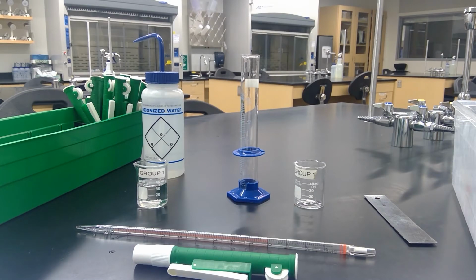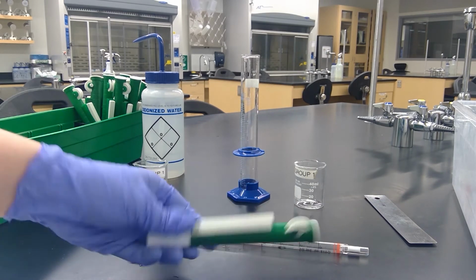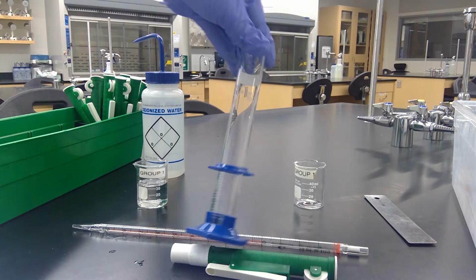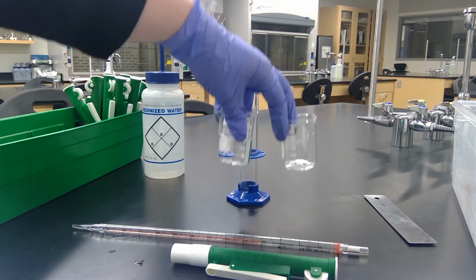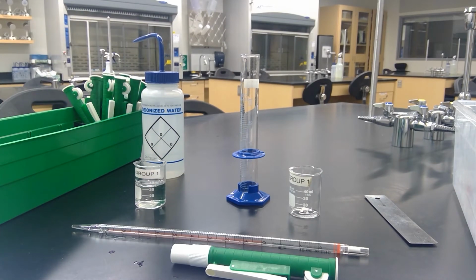For this section, you will use a 10 ml pipette, a pipette pump, a 50 ml graduated cylinder, and 2 50 ml beakers. You'll want to study each tool's calibration markings, comparing the width and length, and looking for the digit of uncertainty for each tool. So I will try to include close-up pictures as well.